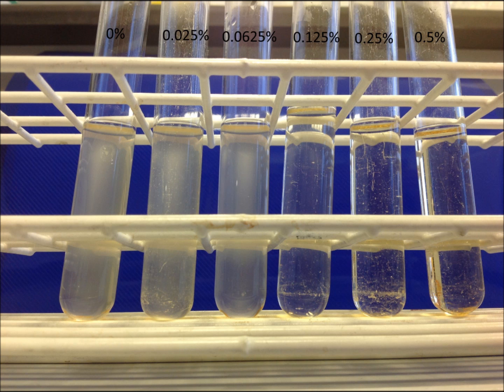This is the experiment that we set up to work out the minimum bacteriostatic concentration for our disinfectant. In this case the disinfectant is Chloros and we've got a range of concentrations starting at the right hand side 0.5% with the lowest concentration of Chloros at 0.025%, and then we have a control which doesn't have any Chloros in it at all.